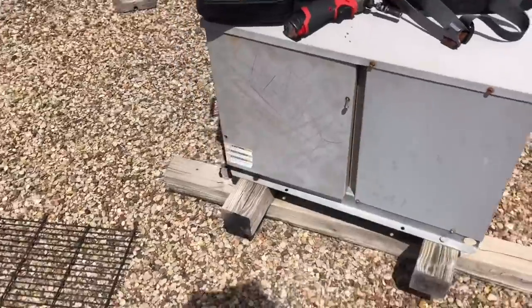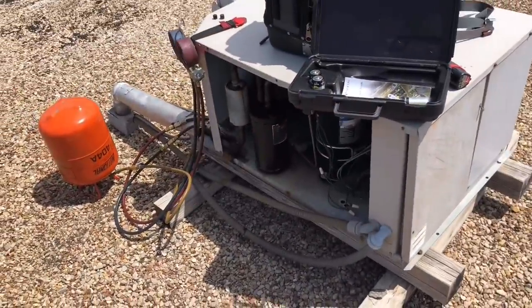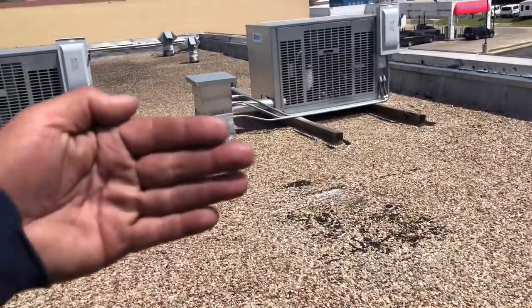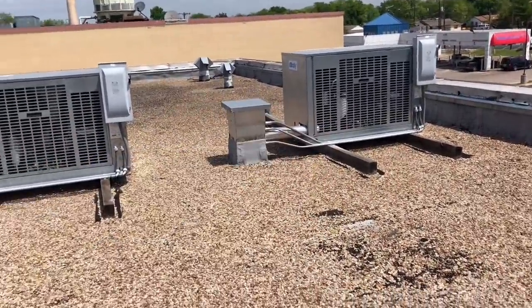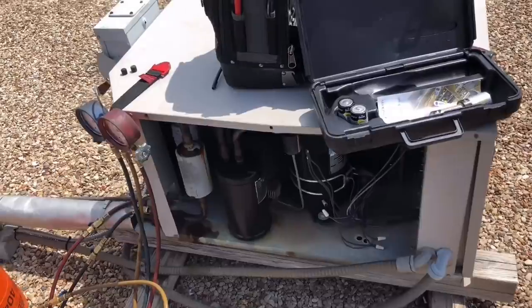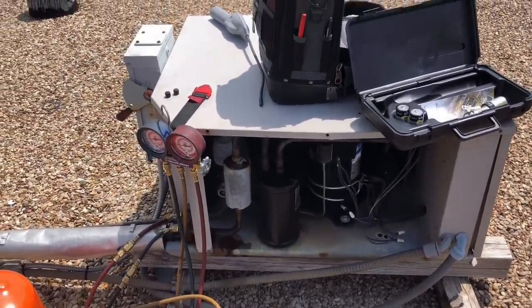This place is a blood plasma bank, so this unit just feeds a little anteroom. Once you go into the anteroom, you go into the two main freezers — freezer three and four. We'll get them up and running for tonight, for the weekend, and we'll talk to them on Monday.